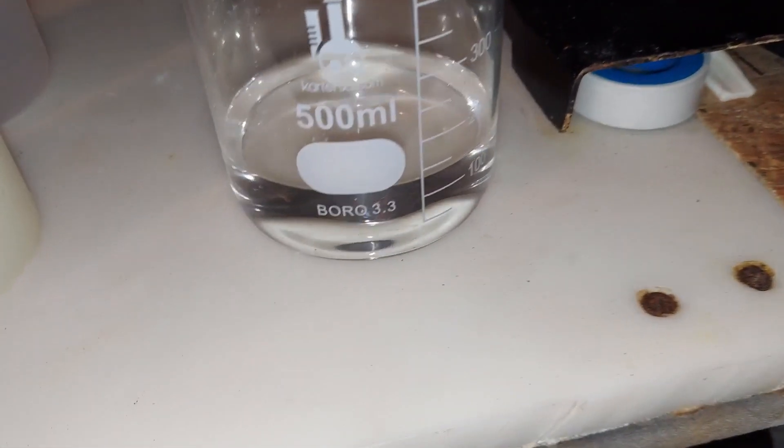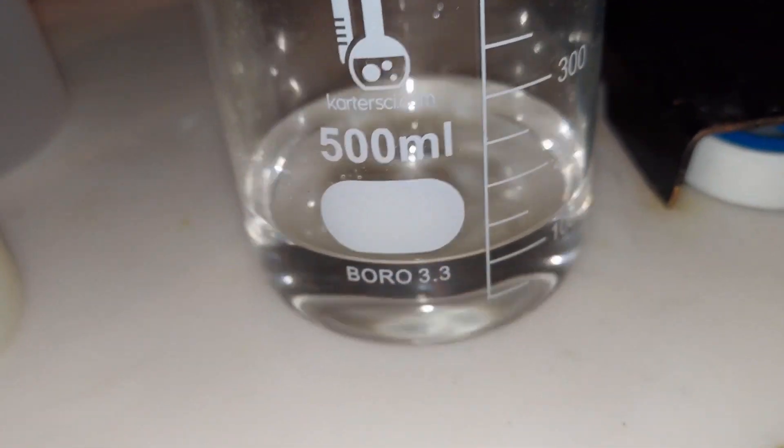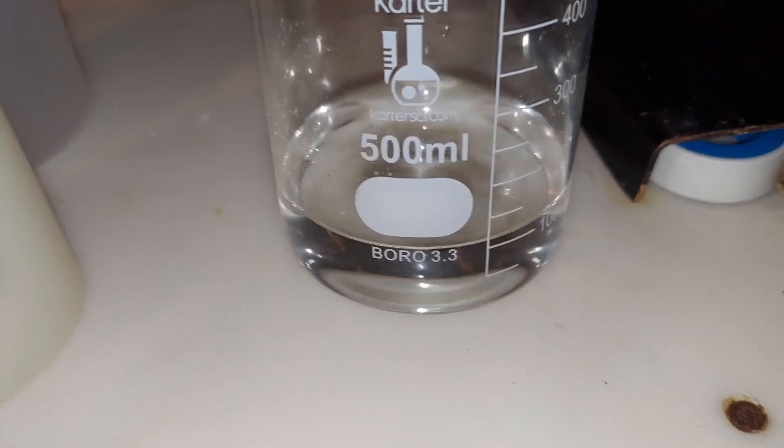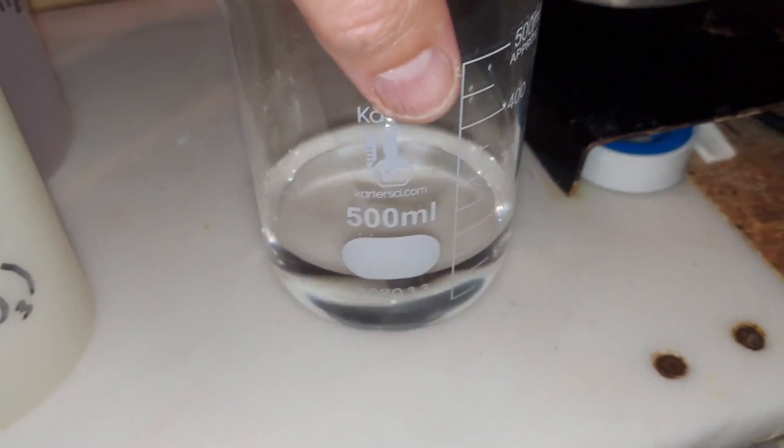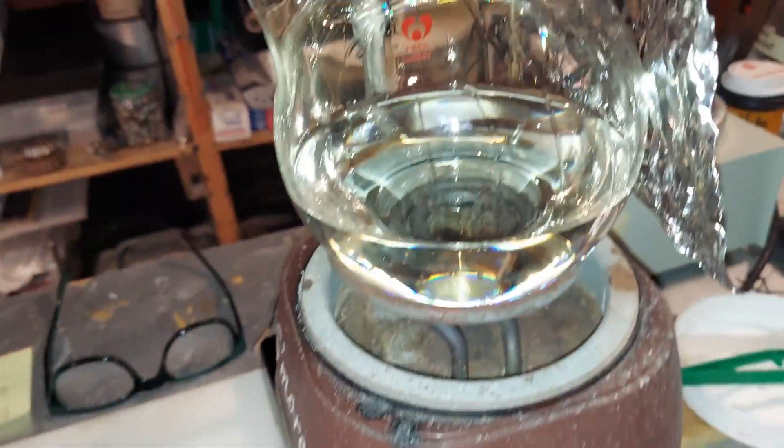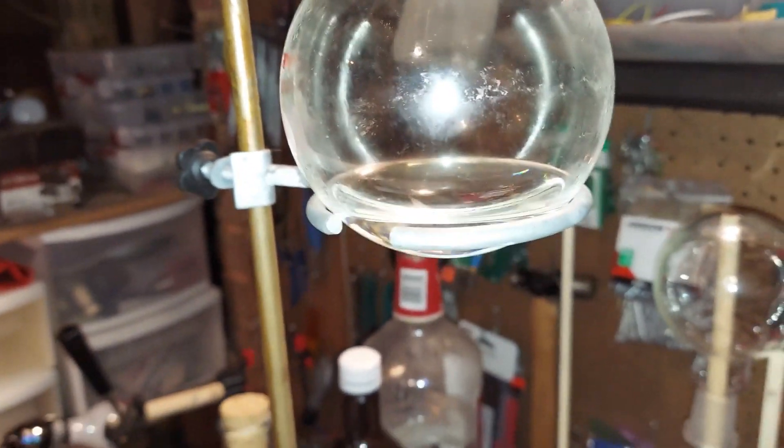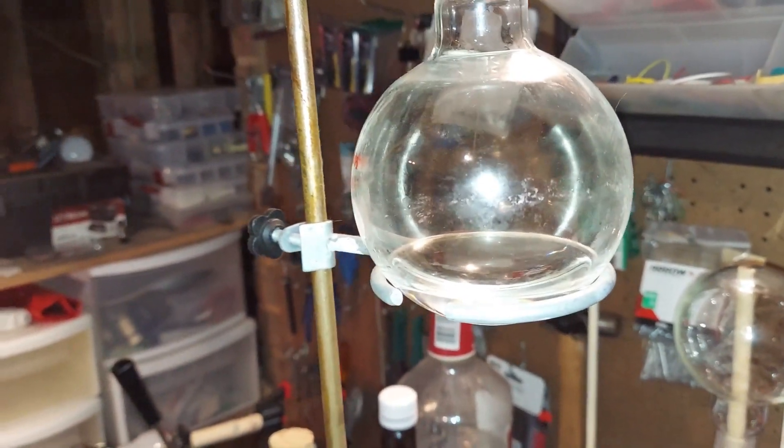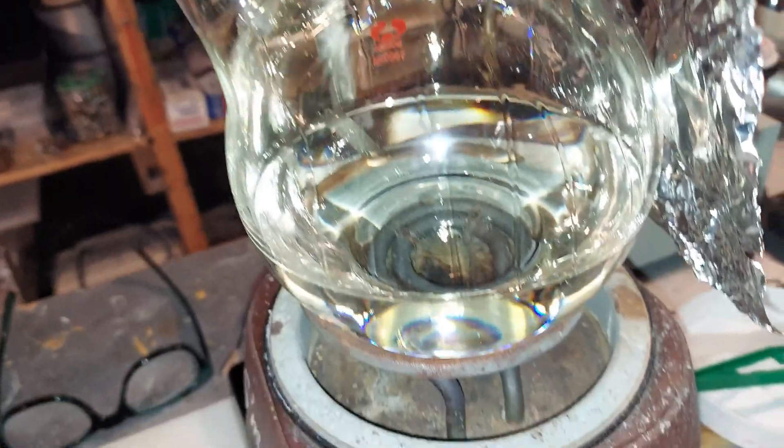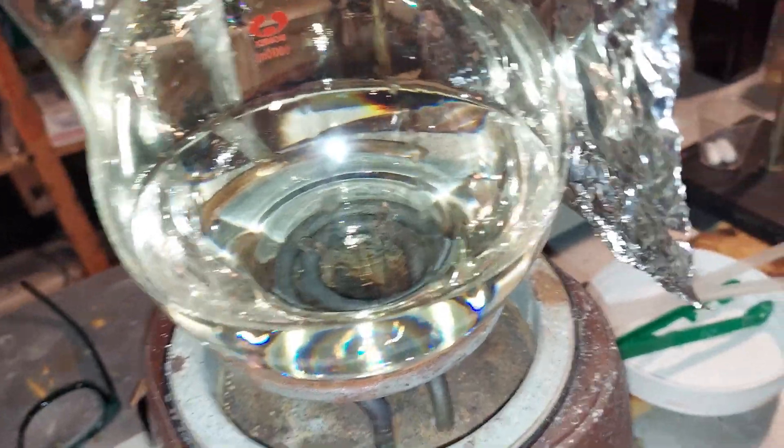I've taken off the watery nitric acid. The temperature jumped from 100 degrees Celsius to 120, which is when the azeotropic nitric acid comes over, and I started to collect it. When I started collecting it, I realized that everything coming over and what's left in here is azeotropic nitric acid.